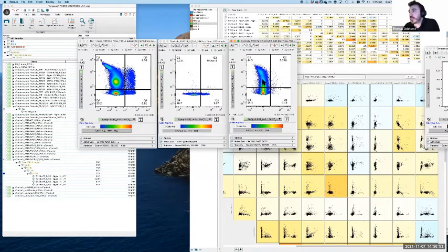So what this tells us is that in this case, there is no PE-Cy7 at all, and so you see nothing above this line. There is no signal there whatsoever. You can see in this case that in the absence of PerCP-Cy5.5, you're still seeing that pattern of leaning over to the left. With overcompensation, it's usually reasonably obvious, because it's a population that, as it gets brighter, is mathematically curving over to the left into a space where there shouldn't be any cells. So this one is arguably the easier situation to deal with because it's so obviously abnormal.